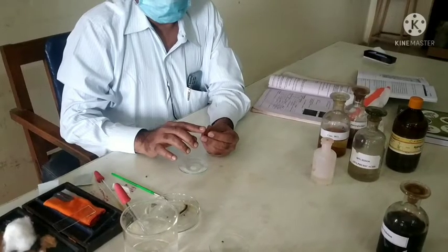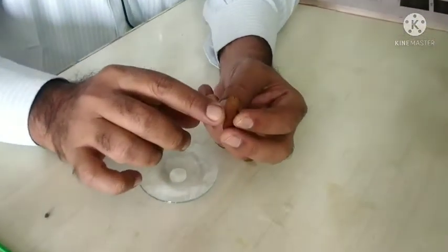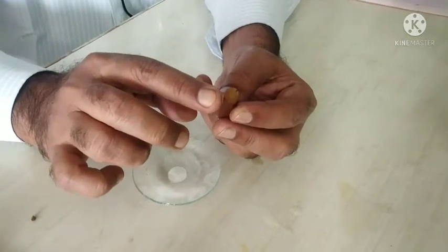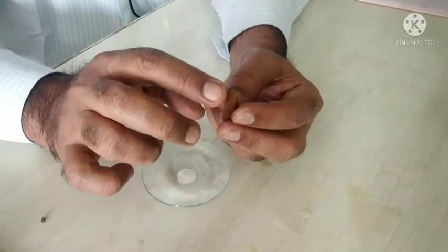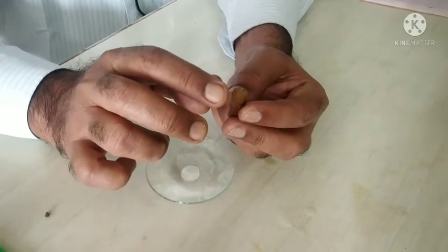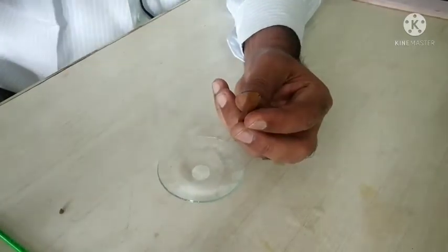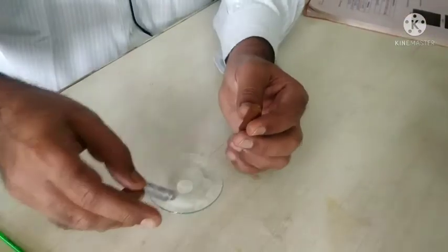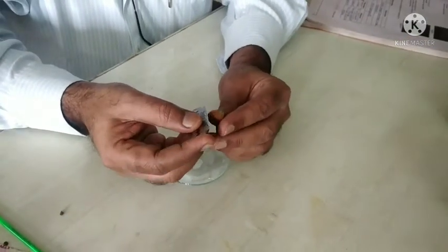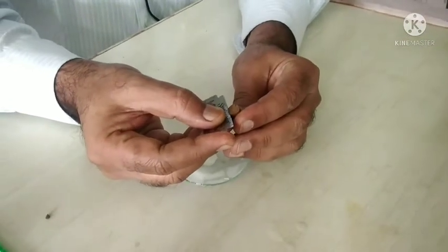Now we are taking the boiled and cooled unpeeled licorice roots. Take it in the left hand, and with the help of a sharp razor blade, take a thin transparent section of the unpeeled roots. When we observe the unpeeled roots, it shows the outer reddish-brown cork, then cortex, and in the center it shows xylem and phloem. With the help of a sharp razor blade, first we uniformly make a cut transversely.